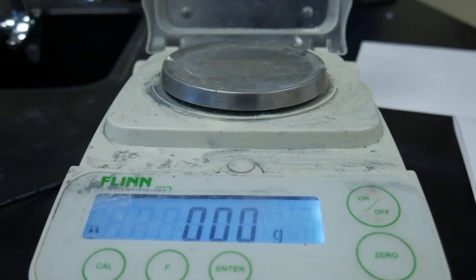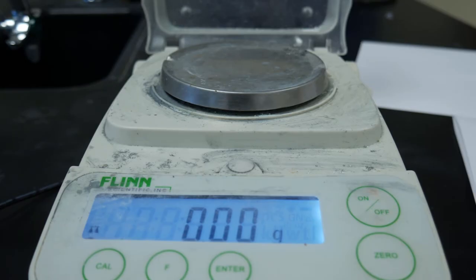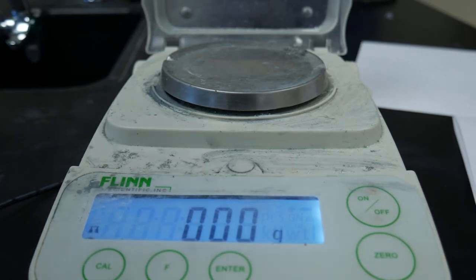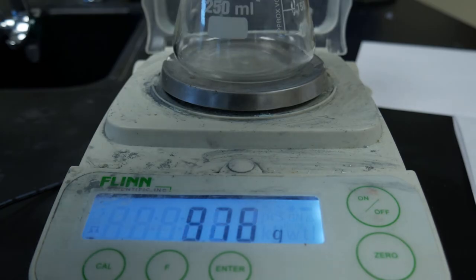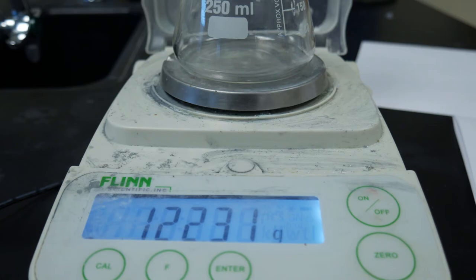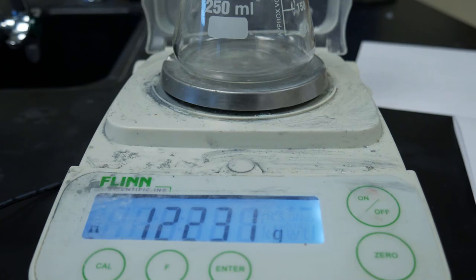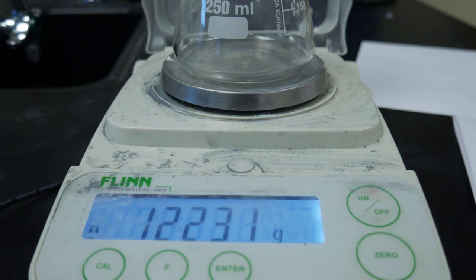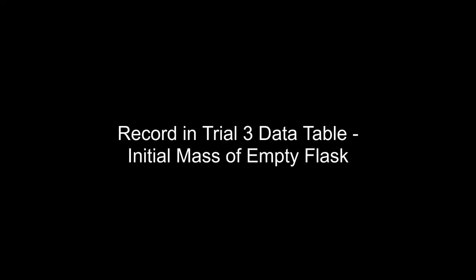For trial number three, we are going to record the mass of an empty flask. We have a 250-milliliter flask here, and we're going to record what it weighs. We have 122.31 grams, so please record that on your data table for trial number three as the mass of the empty flask.